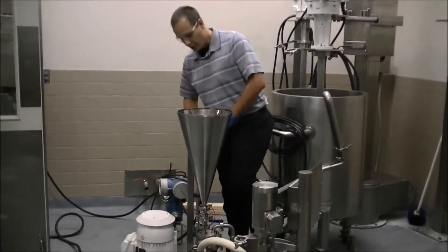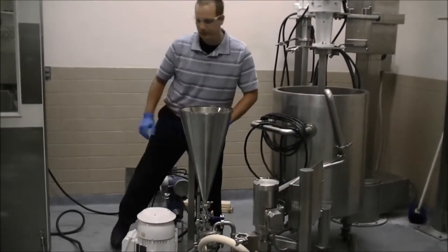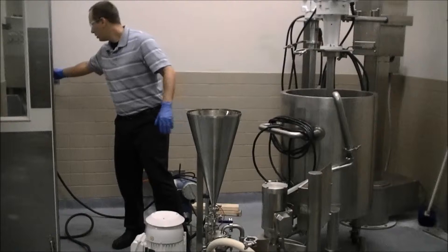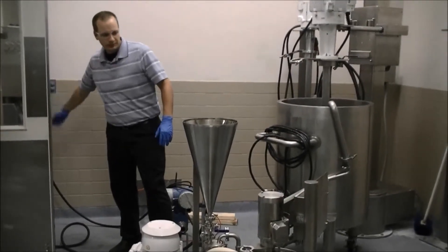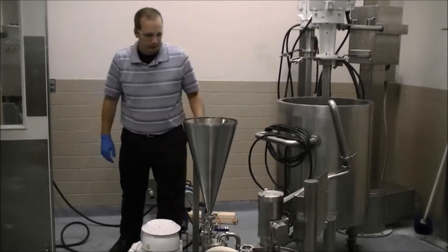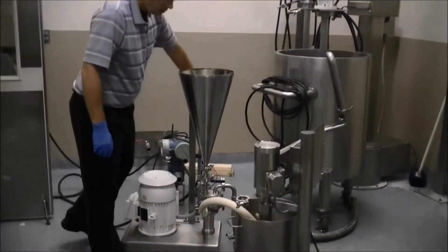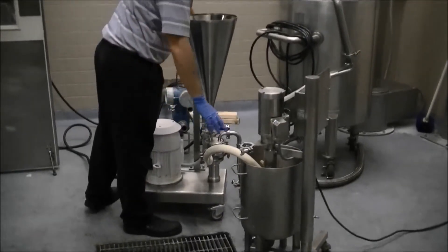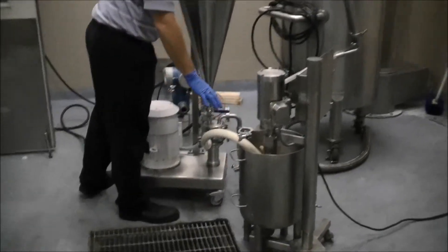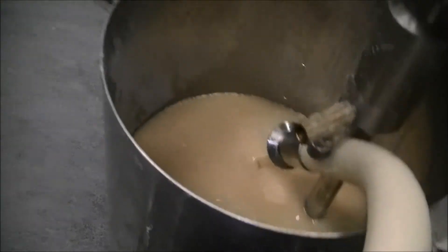We'll start off by starting our disperser and our pump. Once we establish liquid flow, we start our dispersion.